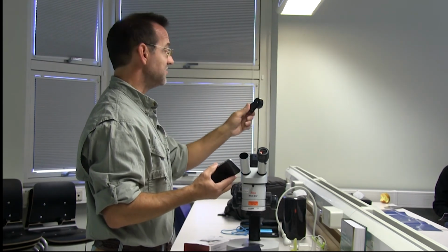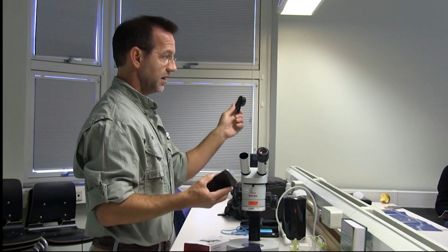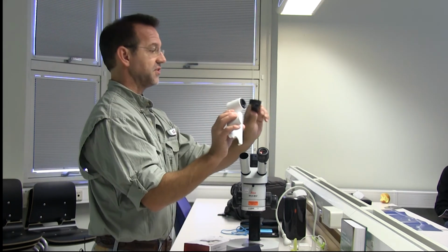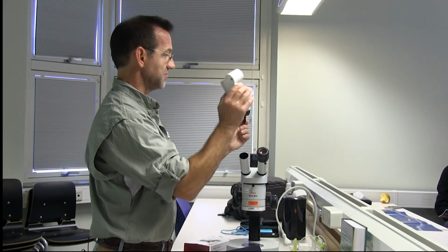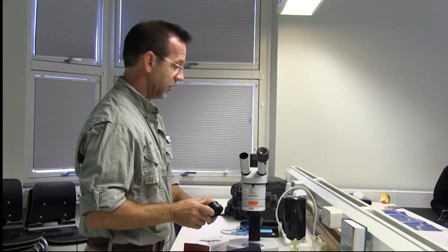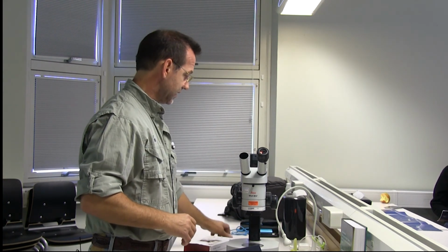And there are many different types of these on the internet, but here's the thing that all three of these have in common. This is glass, and this is glass, and this is glass. So those are the three options that I wanted to show you for the microscopy.